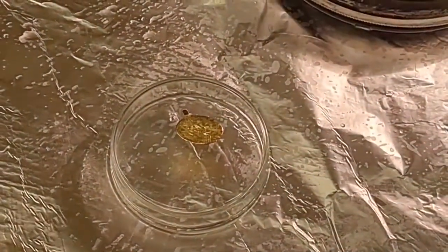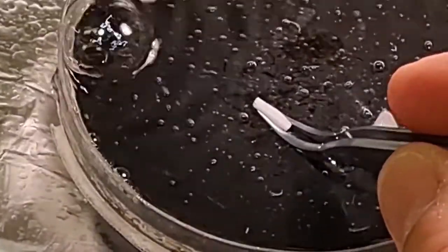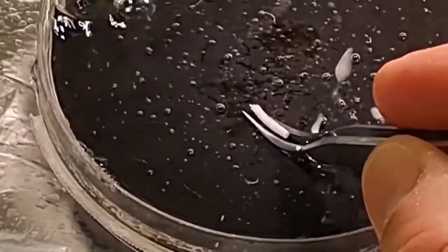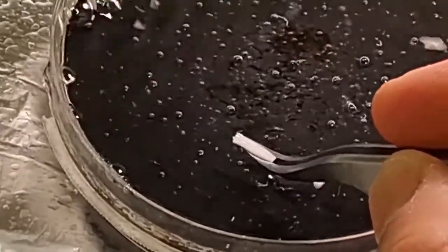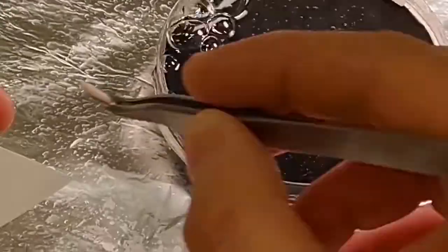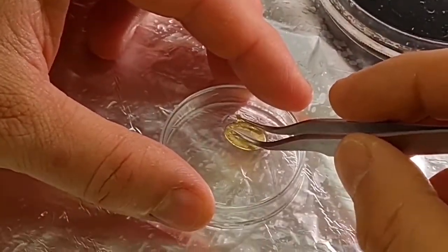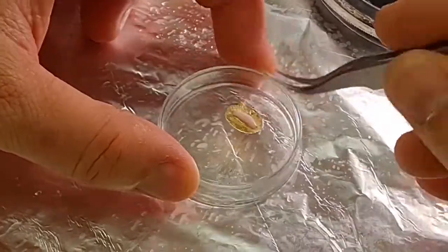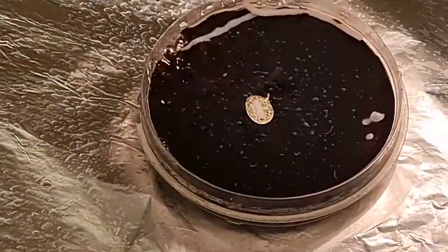For this procedure, we need to lift out the spinal cord block from the ACSF. This has to be done quickly to minimize the hypoxic damage. Once lifting the cord, carefully get rid of the moisture from the bottom with the filter paper, drop it gently in the fast glue on the gold plate, and then quickly immerse it again in ACSF.